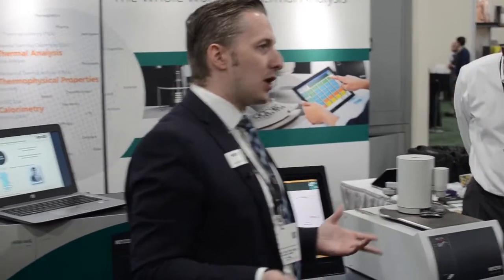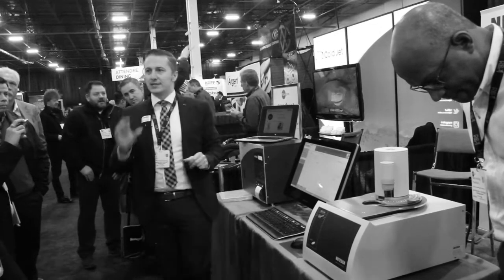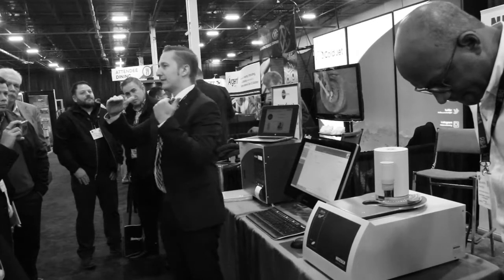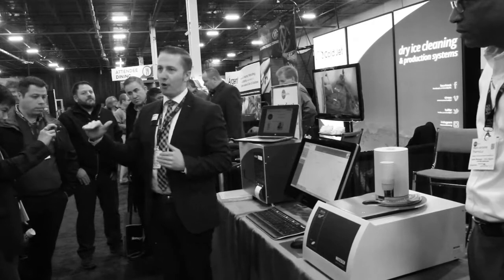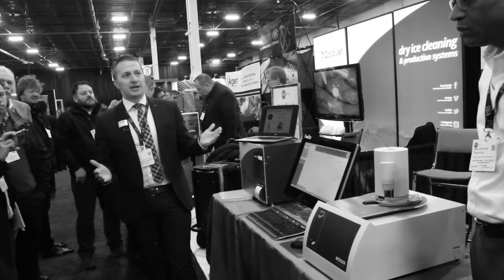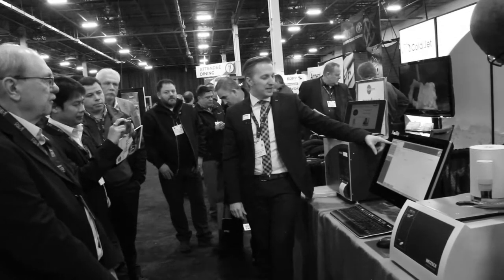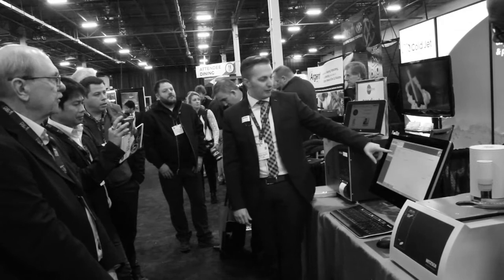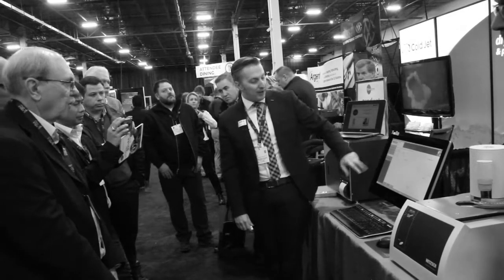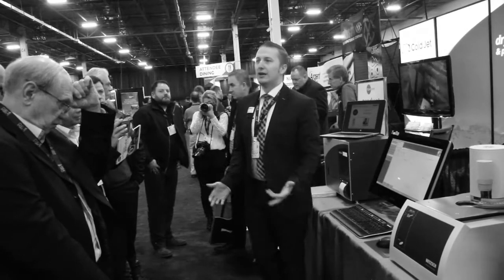It depends on the parameters you choose. If we have a room like this, we can keep the instrument stable at 20 degrees C gradient and a mean temperature of 20 degrees C, and just exchange the sample. As long as you measure at this particular temperature point, the instrument can stay in this condition and measurement time can be optimized. We are starting from a mean temperature of 24 degrees C and going down to 10 degrees C with a gradient of 20 Kelvin. The temperature of the plates is dropping, and here you see the heat flow signals of the heat flow meters inside the plates. Once this condition is stable, you wait, and after stabilization of the heat flow meters, we take the measurement point.